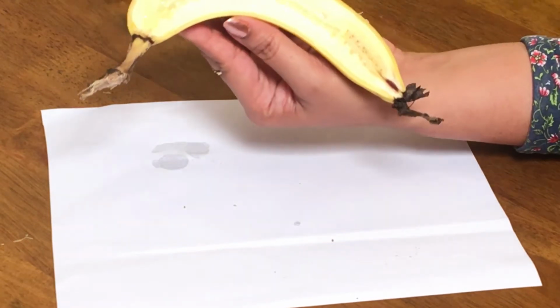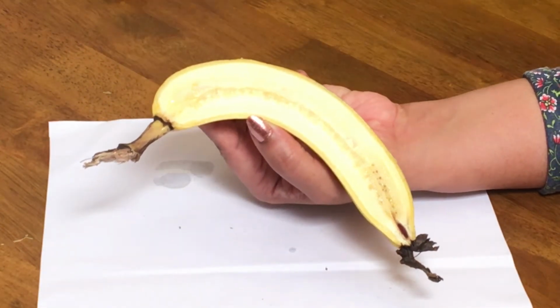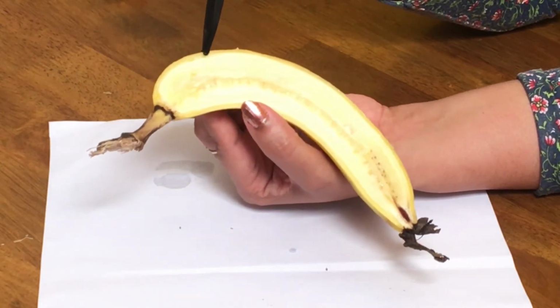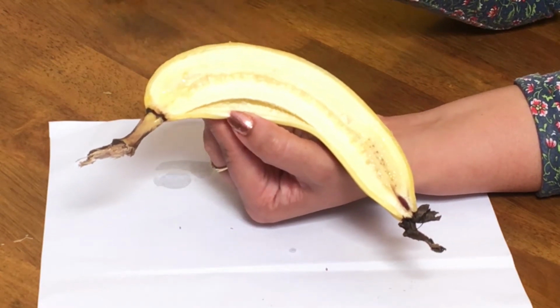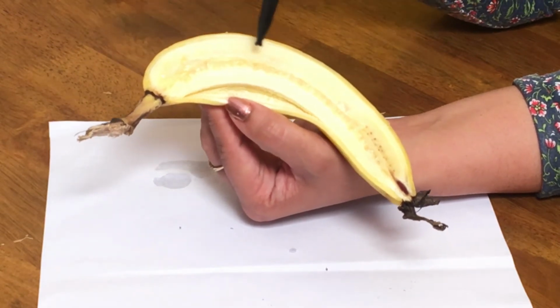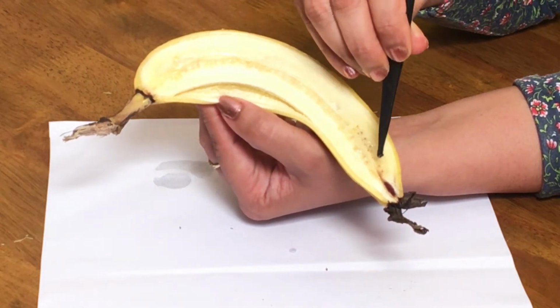Okay, this is a longitudinal section of a banana. This is the pericarp, which is divided into epicarp. Epicarp is the peel. This fleshy part, which is edible, is the mesocarp, and this area has the endocarp. And in certain places you can find some tiny brown dots, which are the seeds.